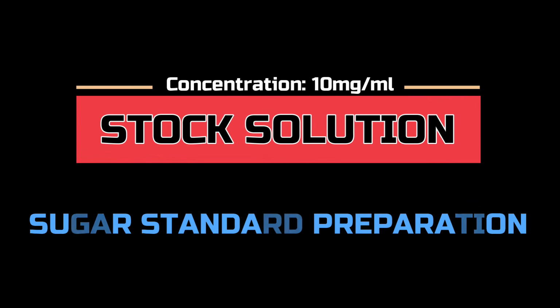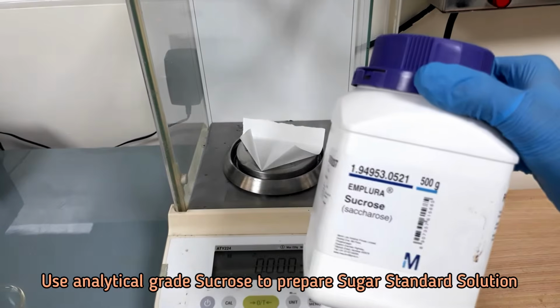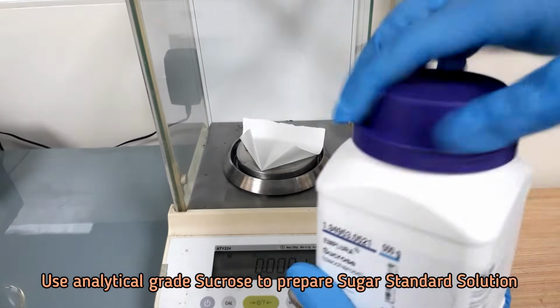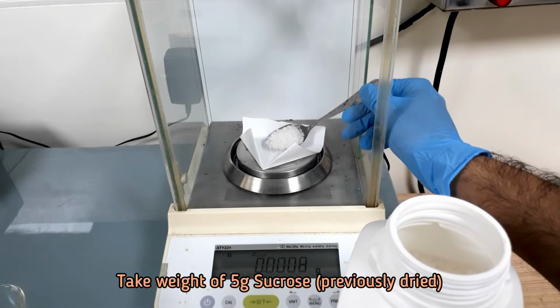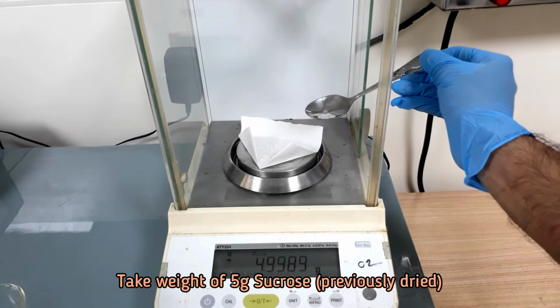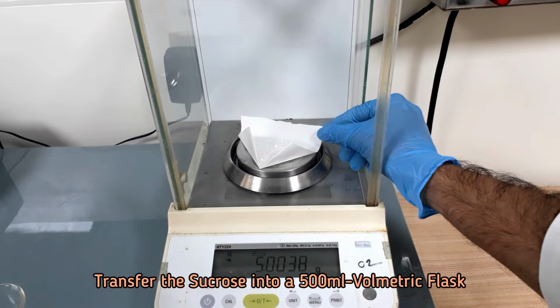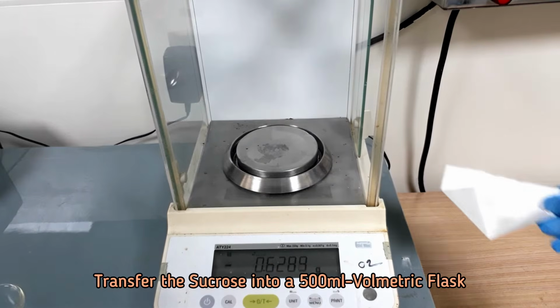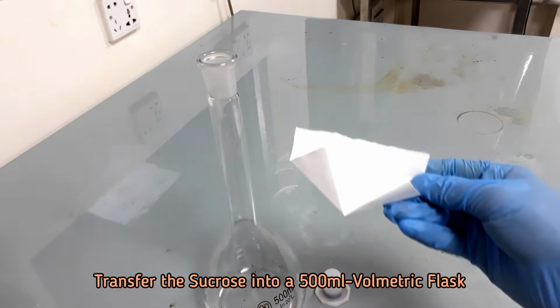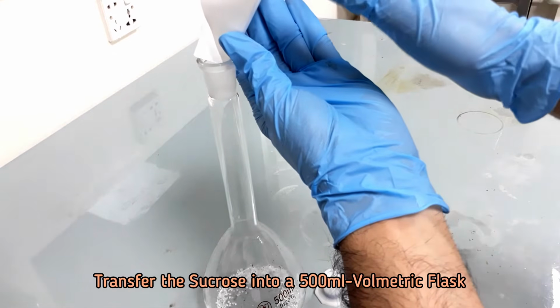At first, we will prepare the sugar stock solution. Take 5 grams of previously dried sucrose. Transfer the sucrose into a 500 ml volumetric flask.